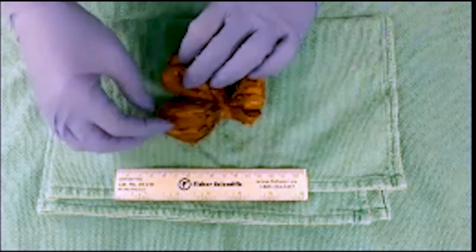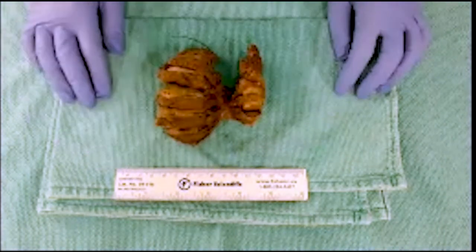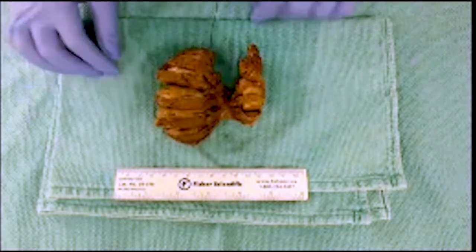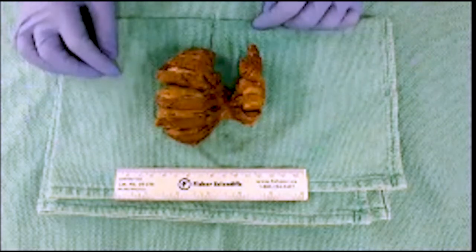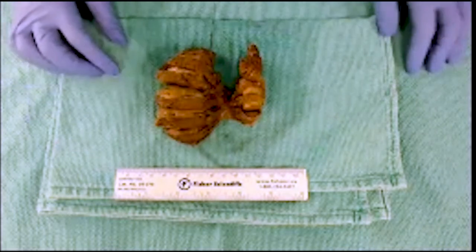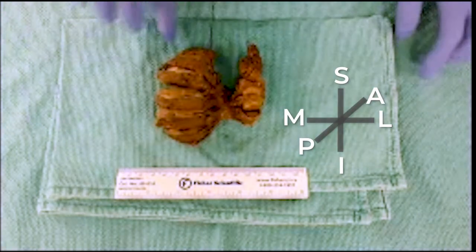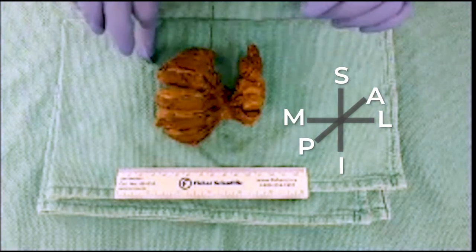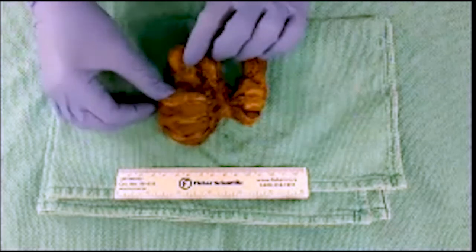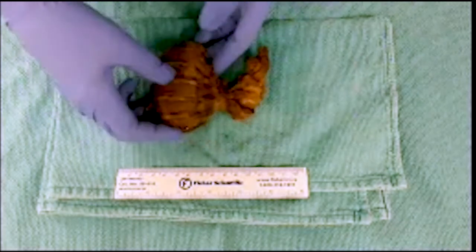When you see a large lesion like this, it's important to document where it is and how much of the parenchyma it is occupying. I would measure this lesion in three dimensions and orient that measurement — superior-inferior, medial-lateral, and anterior-posterior — to give the pathologist an idea of where the lesion is located and how large it is.